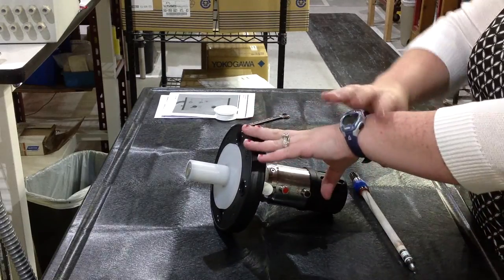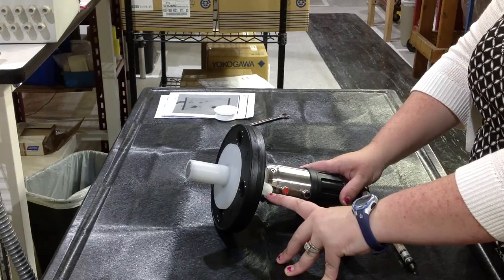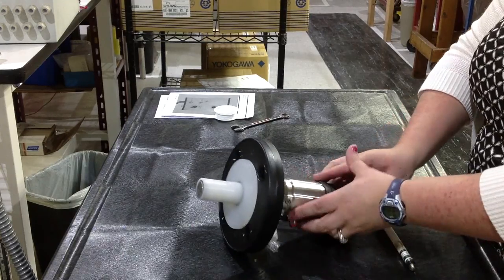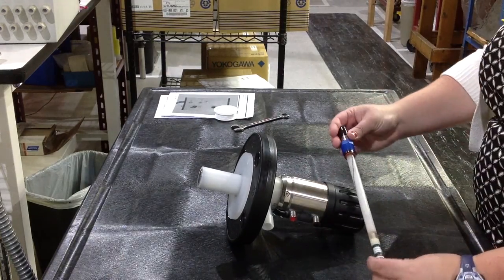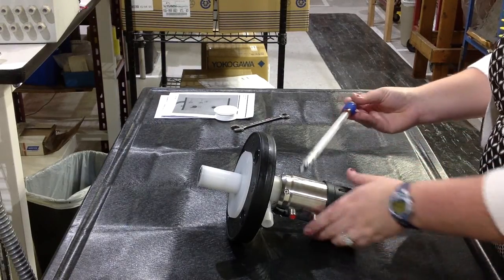You need the manual version. We don't have them here, but you would need these cleaning ports — one is your in, one is your out. You need a 12mm, 225mm long sensor with a PG-13.5 connection.